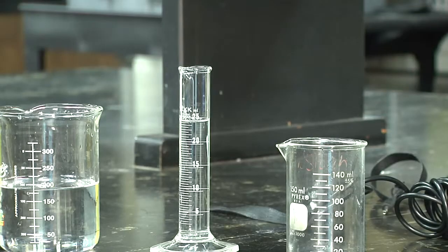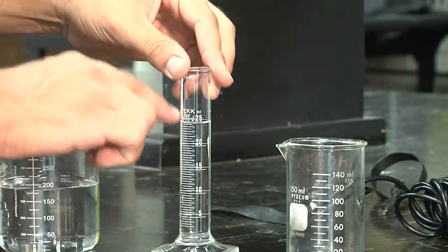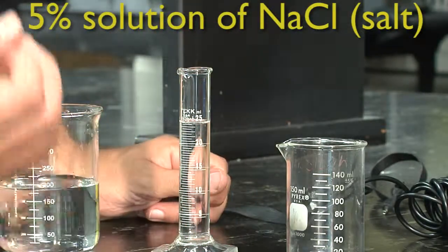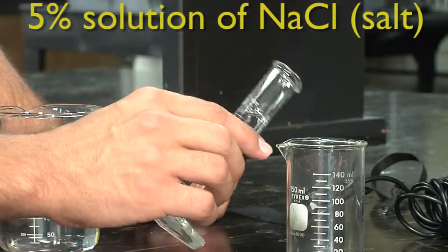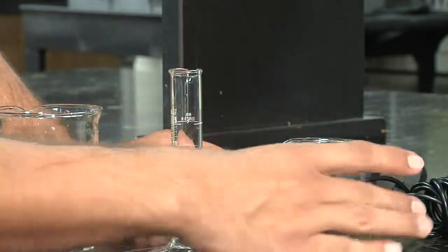And for the last section, to measure out the density of a solution, we're going to measure out the volume of a 5% solution of sodium chloride, NaCl, or table salt, and weigh it in our beaker. And then when we're done, we're going to discard that solution.